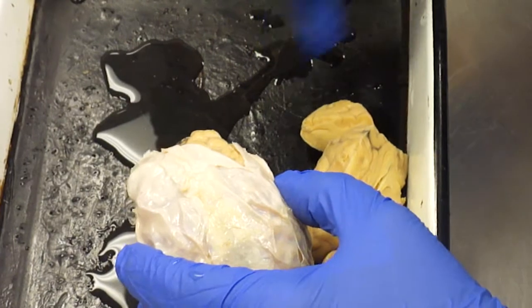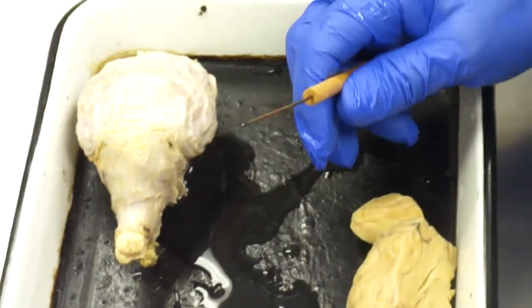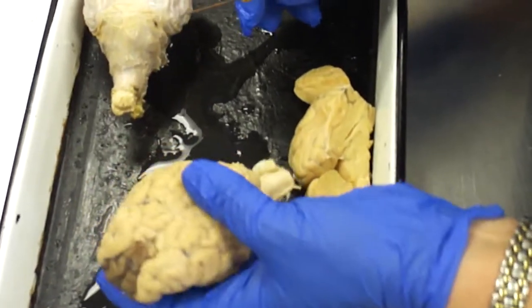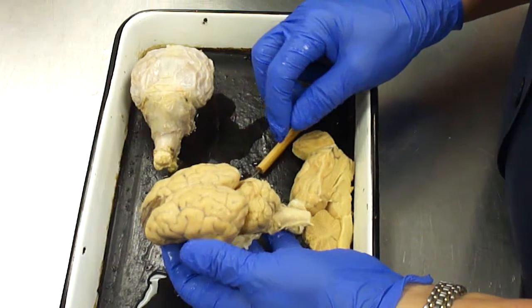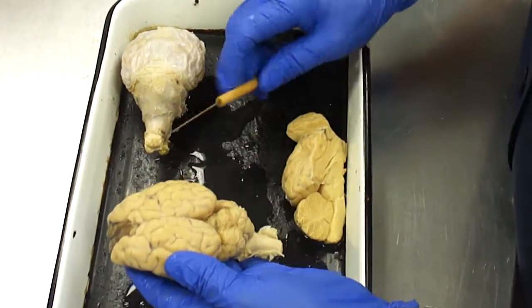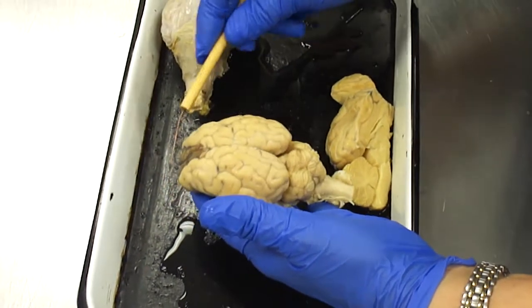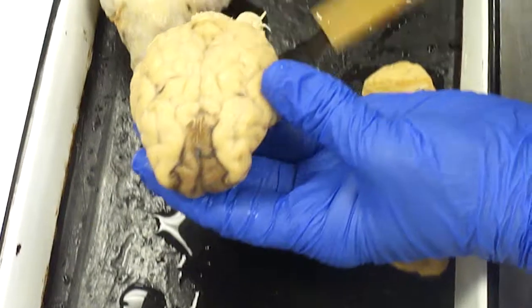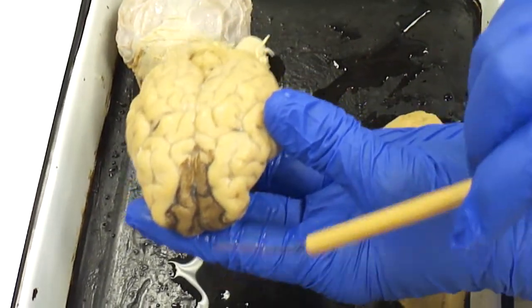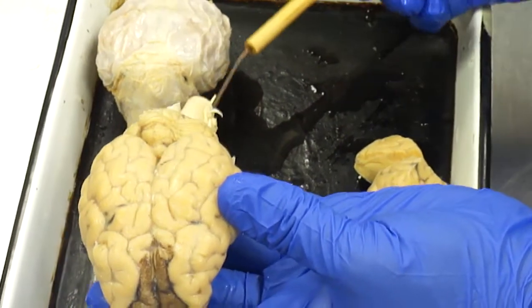Same idea as the parietal and visceral coverings, but they're not calling them parietal and visceral on top of the brain. But the same basic principle applies. So if you take off the coverings of the brain, you'll see that there are several parts to it. This main front part, because here this would be the face coming out here with the eyes and the nose, and this is the spinal cord going down the back, okay?